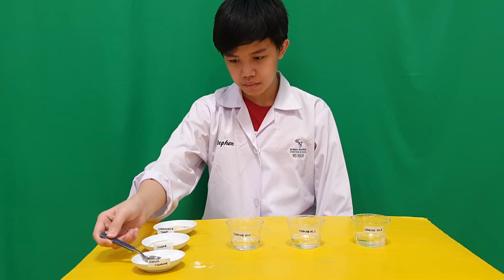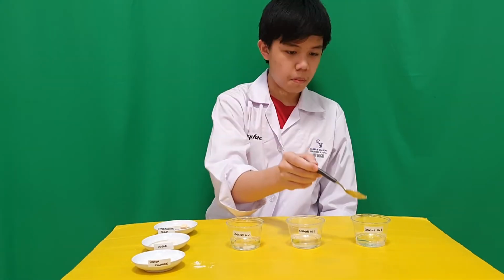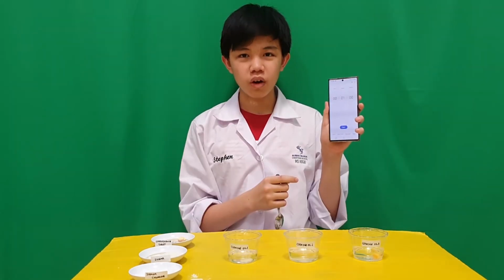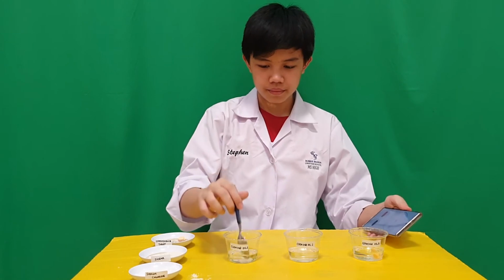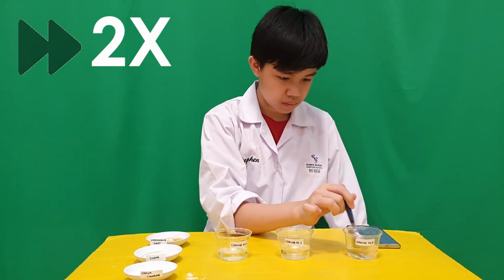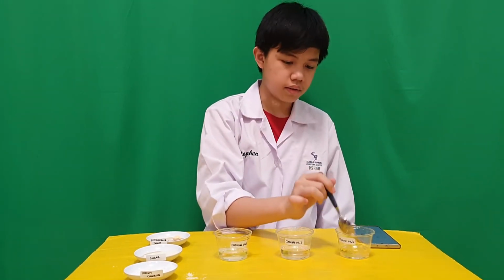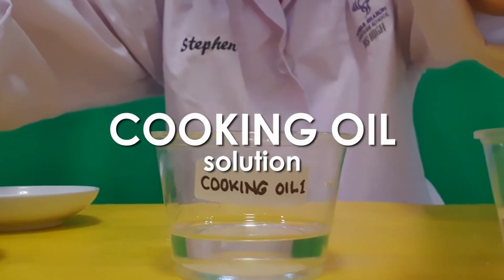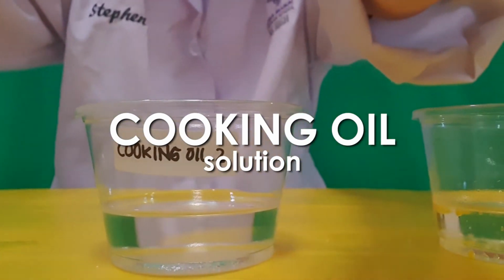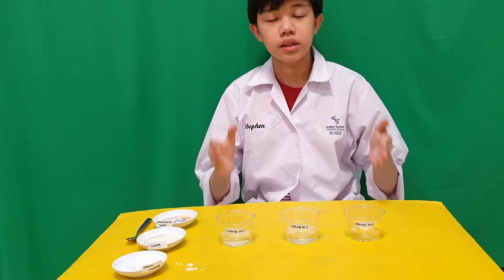Let's change to cooking oil. One minute starts from now. Here are the results. So there is no solute that is soluble in the oil because oil is a non-polar substance.